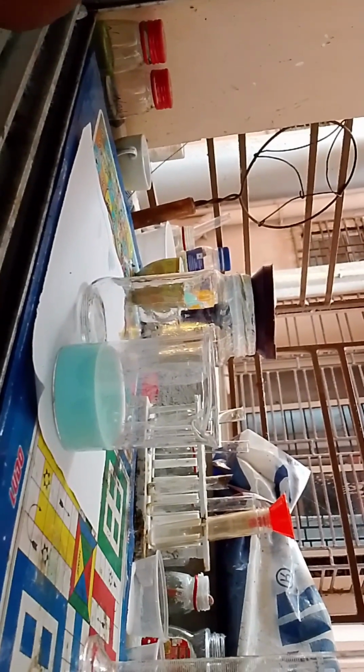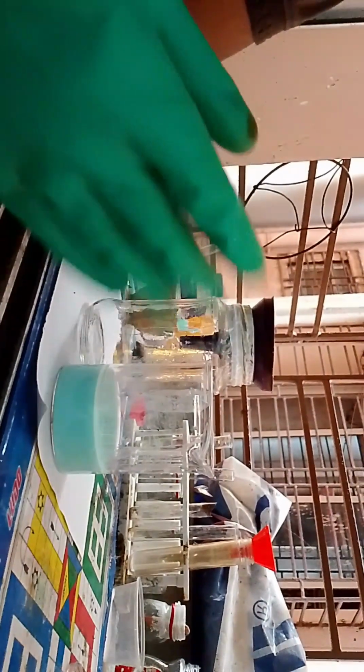Okay, the problem that occurred is that most of the copper oxalate was passing along with the sulfuric acid, and this is because the particles are very small, nanoparticles. You can see a little quantity has been eradicated, but still a lot is remaining.